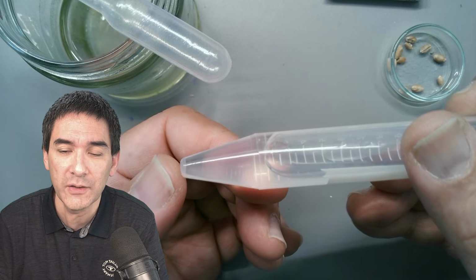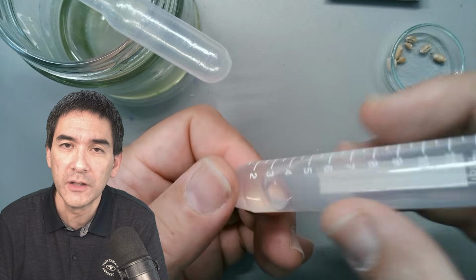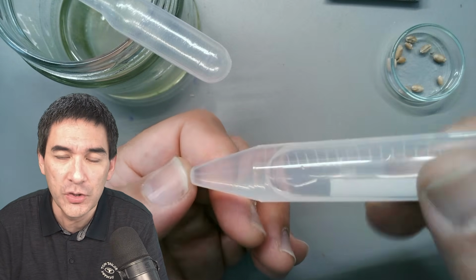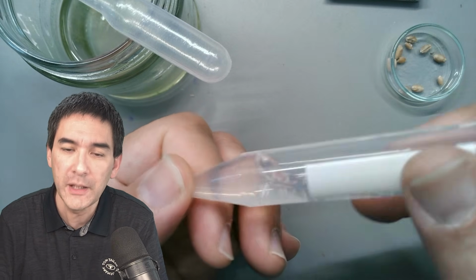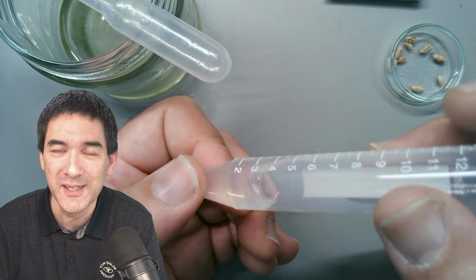And that's what you get. It's a very thick solution, almost like the thickness of honey. You can adjust the viscosity, of course, by changing the amount of water. And the cool thing about this methyl cellulose is that it does not osmotically damage the cells.